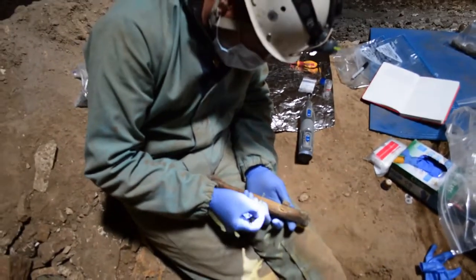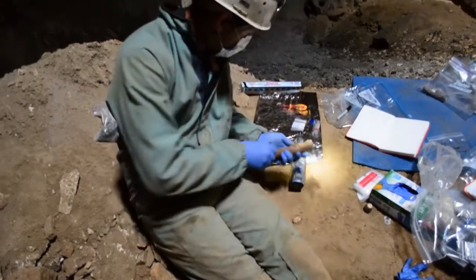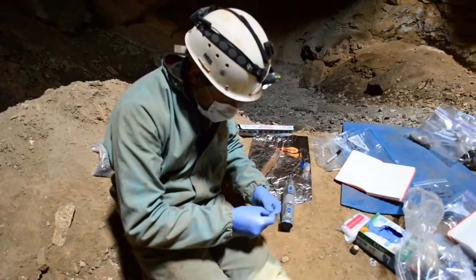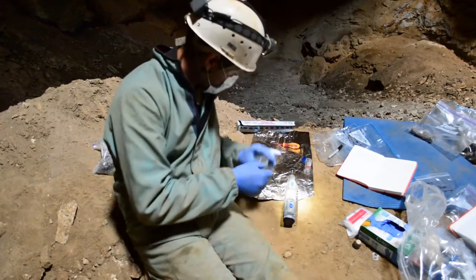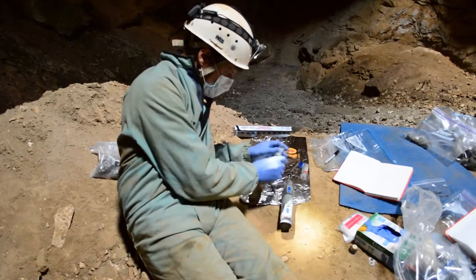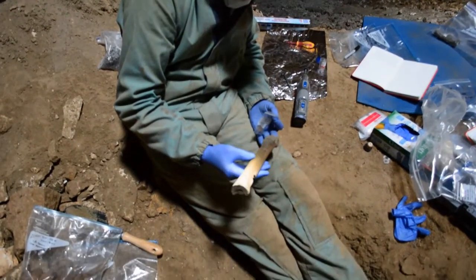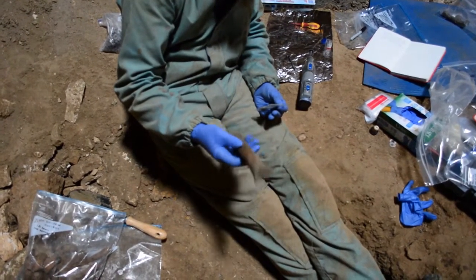It's quite thick, heavy bone. The staining from the water and soil has gone right the way through — sometimes it doesn't happen and I'll show you an example of that in a moment. So I'm going to label it up. This is the sample we take back to Australia via our quarantine service. I'll tap that under there, and that allows us to do DNA, carbon dates, etc. This specimen will stay in a museum as reference material.